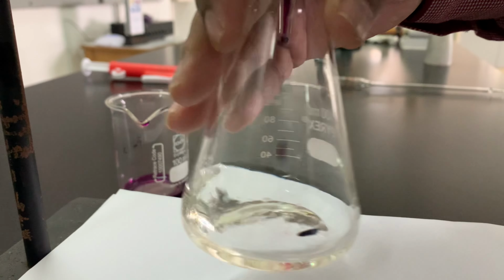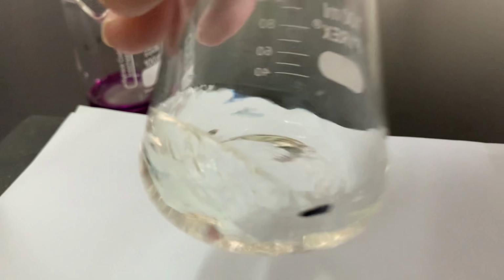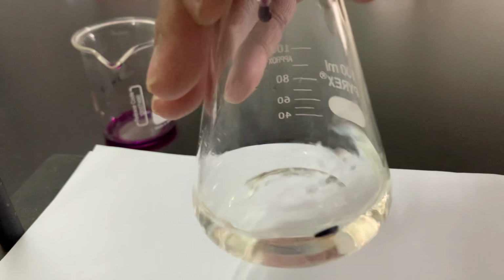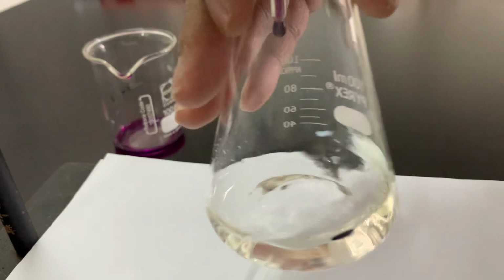Some possible assumptions need to be considered in this titration. For example, we assumed all potassium permanganate reacts only following the chemical equation that we established. If there are alternate reactions, the actual volume of potassium permanganate needed to react with iron 2 is actually lower than what we get from the titration. Your data volume of potassium permanganate will be higher than what it should be. Finally, the mass of iron 2 also will be higher.